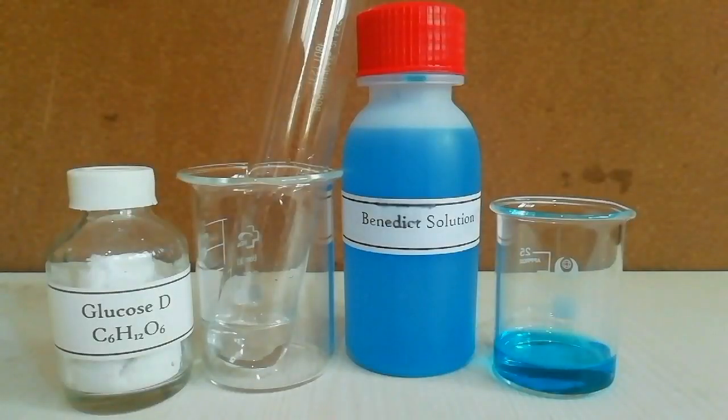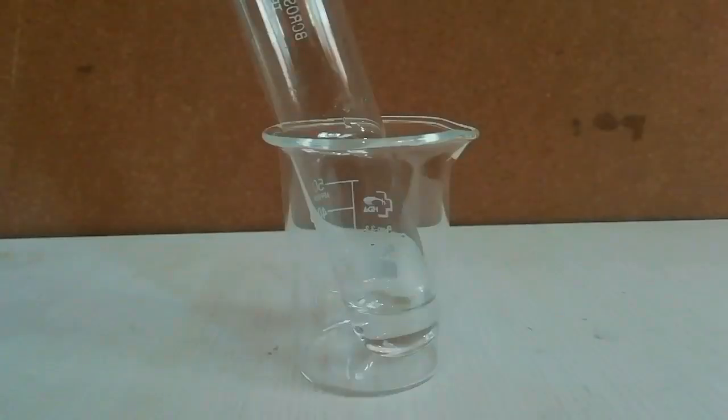Here I have glucose solution as the test sample and the Benedict reagent.